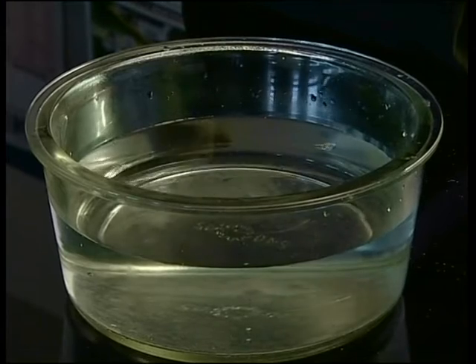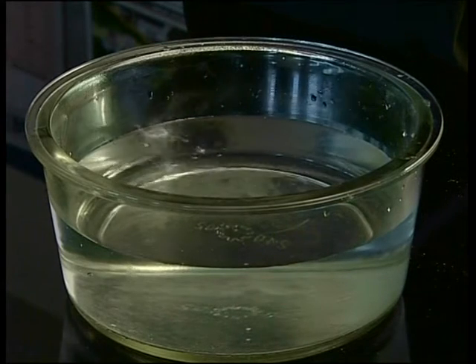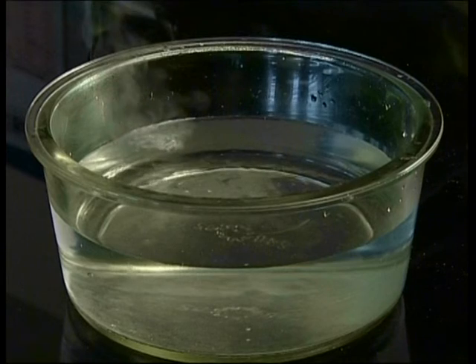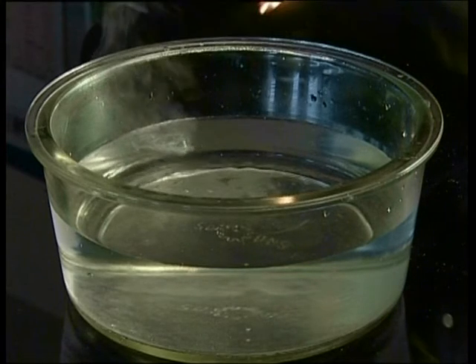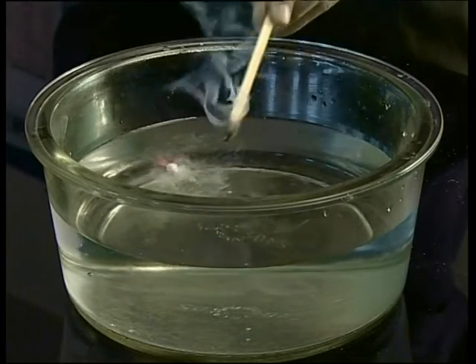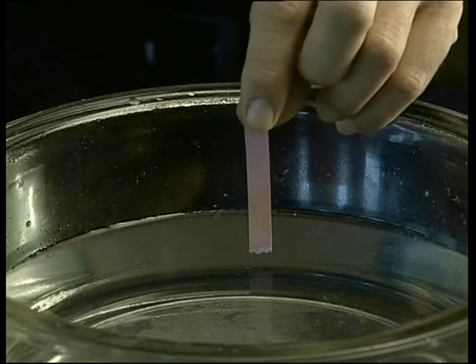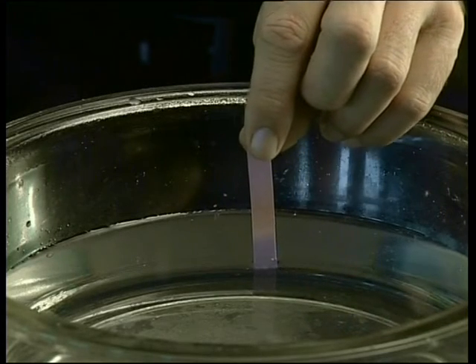First, a piece of lithium is placed in the trough. The lithium floats on top of the water and makes a hissing sound. You should be able to see a whitish gas rising off the metal. Ignite a long wooden splint and bring it close to the lithium metal. A popping sound is heard. When red litmus paper is dipped into the water, the litmus paper turns blue.